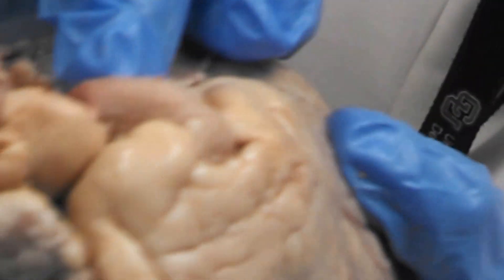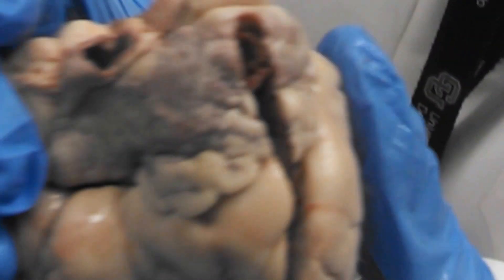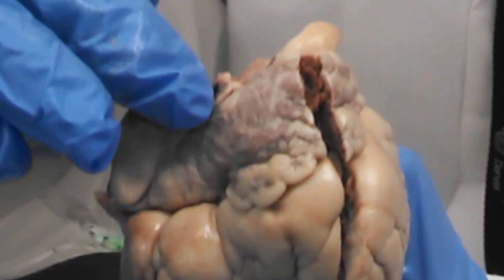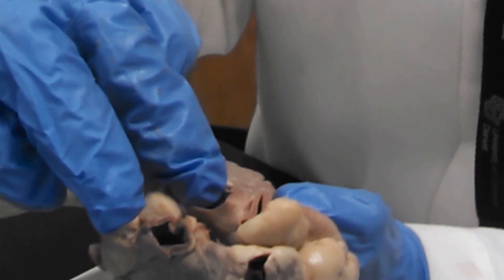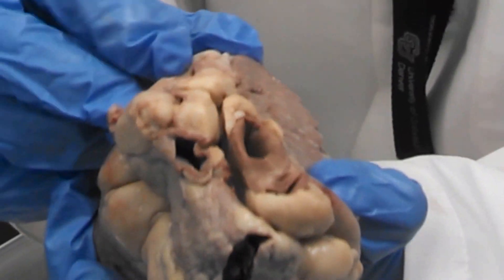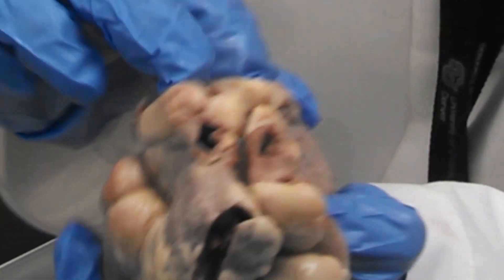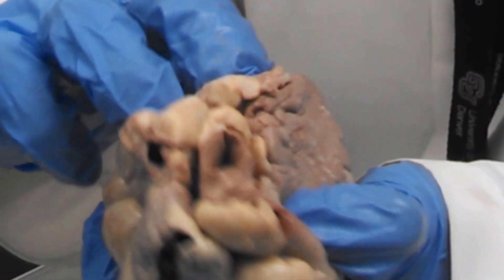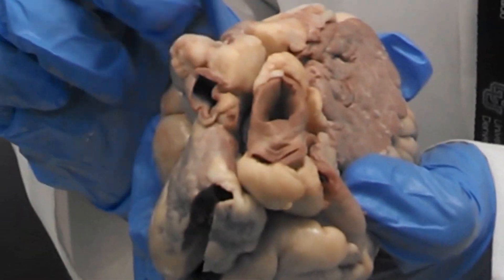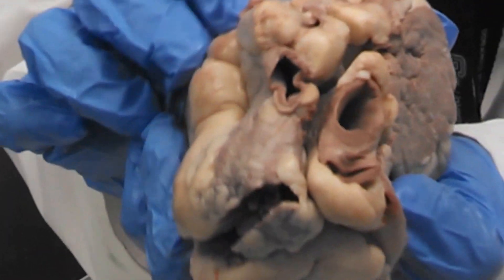Here's our pulmonary artery. Here is our superior vena cava. Here's our aorta. Here's our brachiocephalic. And here are our pulmonary veins coming back in from the lungs.